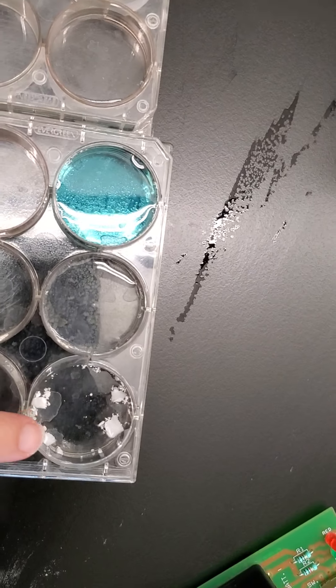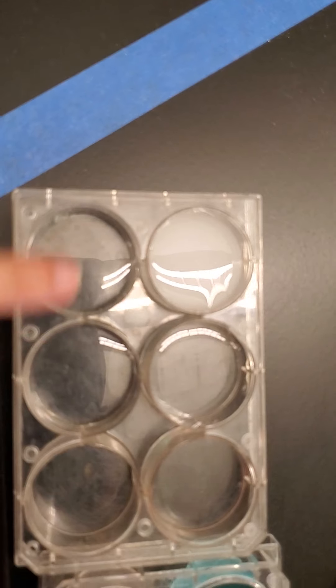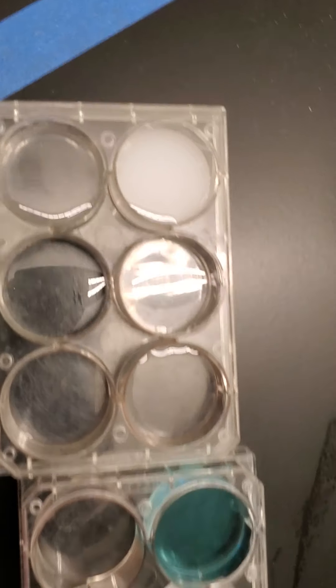Five, six, seven, and eight. Trust me, there's liquid in each one—you just can't see it.